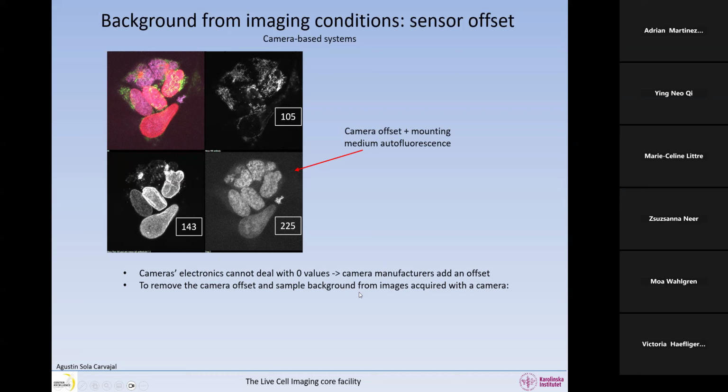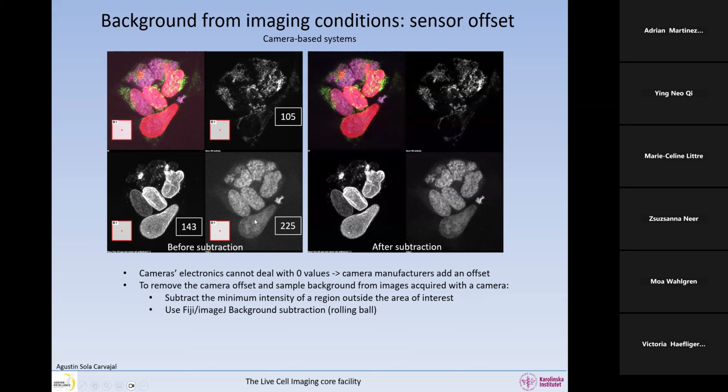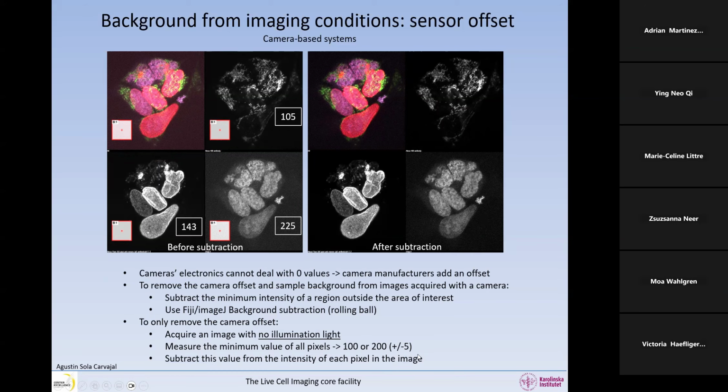To remove the camera offset and sample background from the images, if you have an image like this, where you have a mixture of camera offset and sample background, you can subtract the minimum intensity. You can define an area here, look at the minimum intensity and subtract it from the whole image. So after acquisition, that can be fixed. In Fiji, you can use the background subtraction, which is a rolling ball algorithm, to remove this background and make it a little bit darker. This is totally accepted. Of course, if you do some manipulations like this, you must describe it in the materials and methods. But you can see here after subtraction that we have a much more contrasted image where the background is darker. So this can be fixed after acquisition.